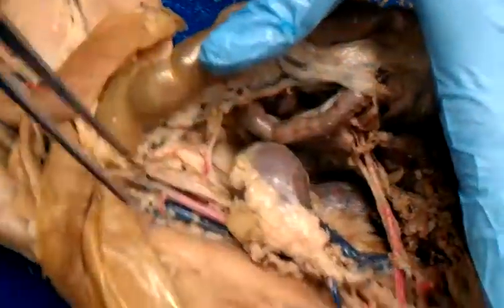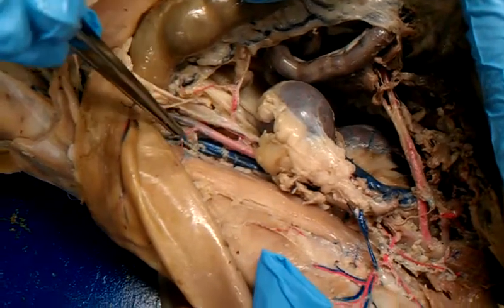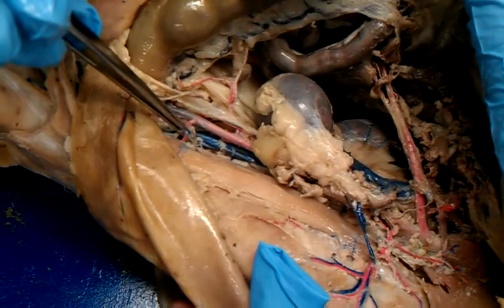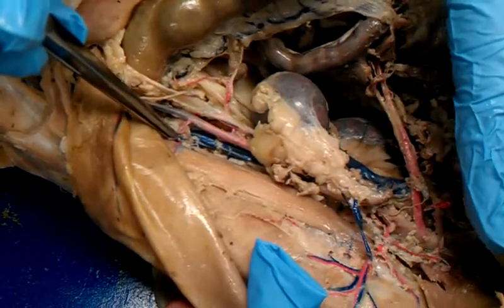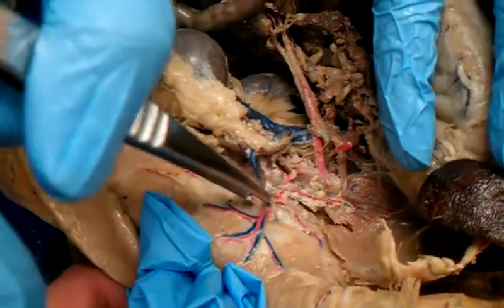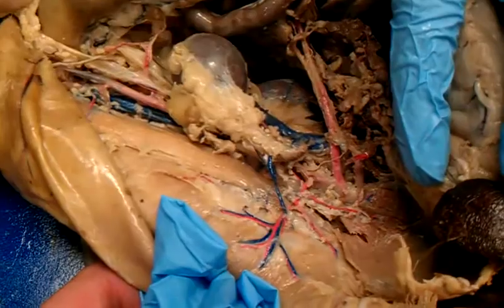Okay, and then also we need our lumbars. We've got our iliolumbar down here, going from the, iliac or ilium? Iliac or ilium? To the lumbar region of the spine. And then we've got the, up here is the adrenal lumbar, going from the adrenal gland to the lumbar of the spine.